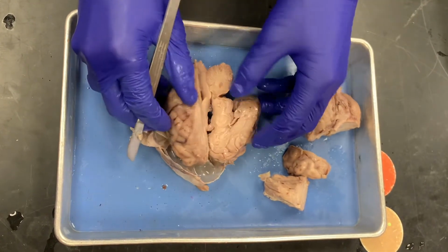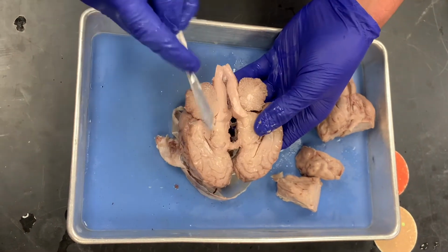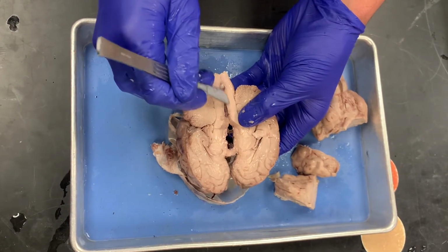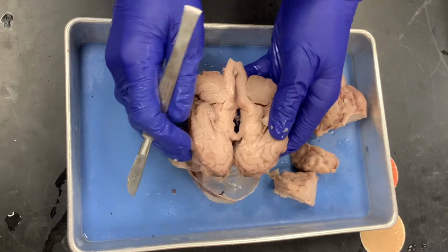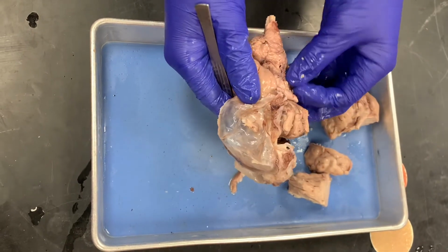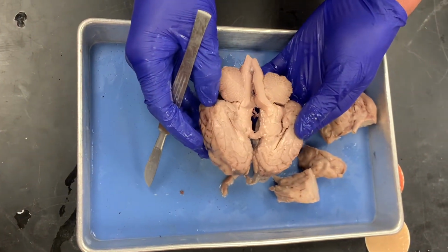Okay. So now if I cut it, let me see about cutting this part. So then if you look at it this way, you can see the white matter within the cerebellum, and then you can see the gray matter there on the outside. You can also see that this part is where the pons is, and then the medulla is what would be there on the bottom. You can also see this is where the pituitary gland would be, but it's not actually shown. But yeah, so that's the sagittal structures.